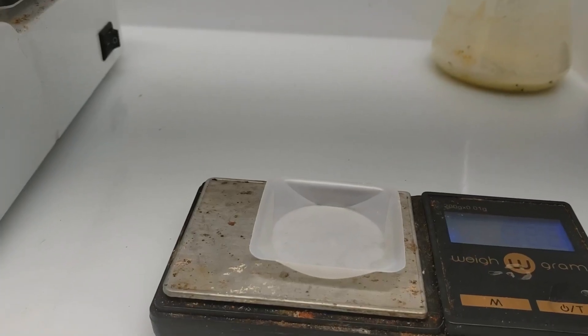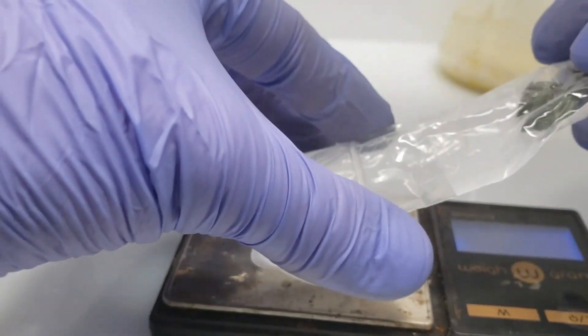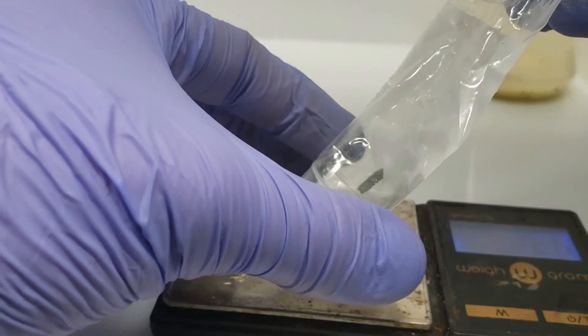First, the 10 gram sample of Praseodymium that I ordered was laid out to ascertain its true mass, which was actually about 9.9 grams here.